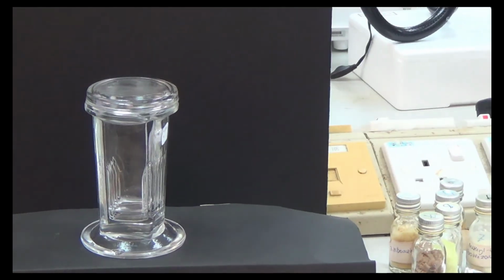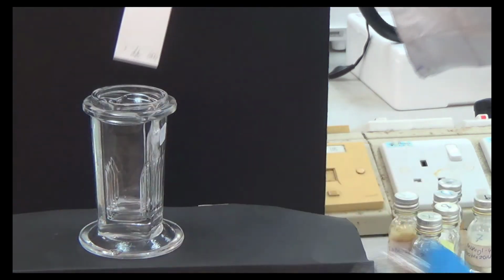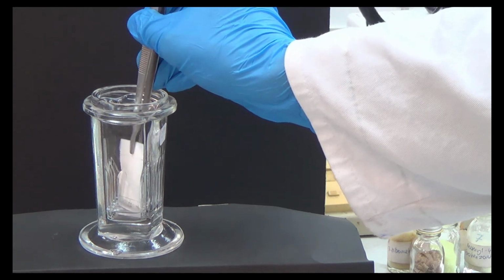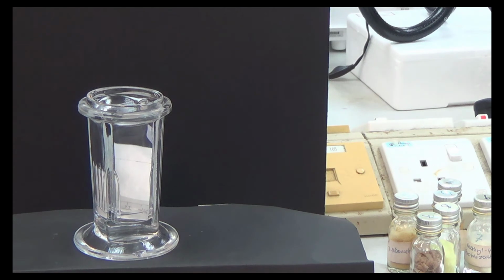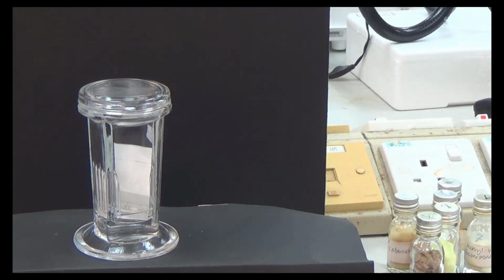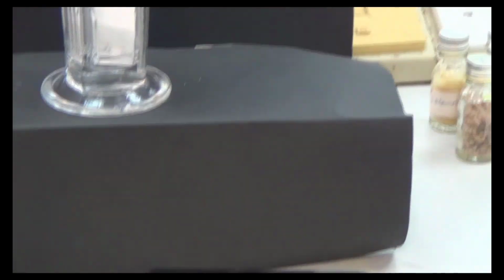Let me put first the second TLC paper inside this. Okay, I put that carefully. So here, let me check. Can you see now? Yes, sir. Clearer, more clear. Yes, sir. So that's what I saw. So I'm using the camcorder now.